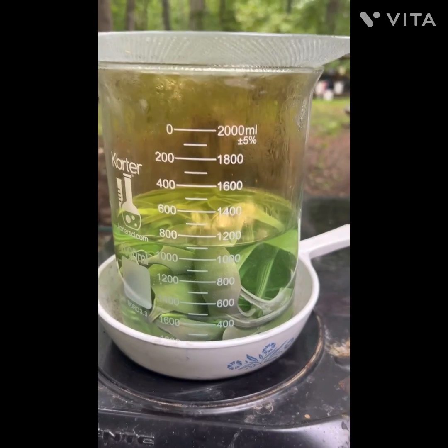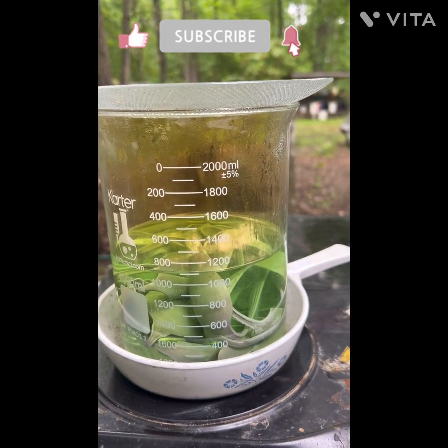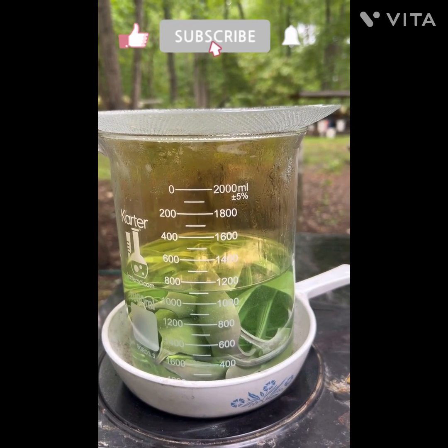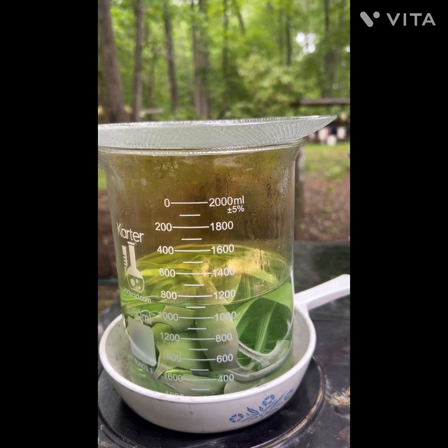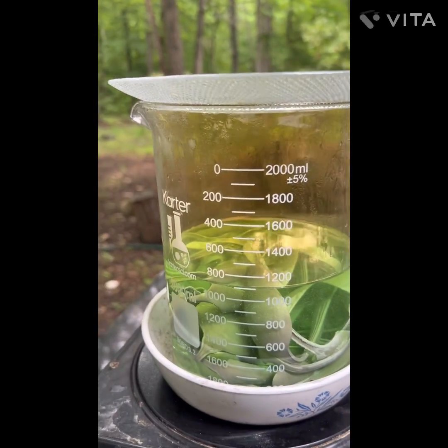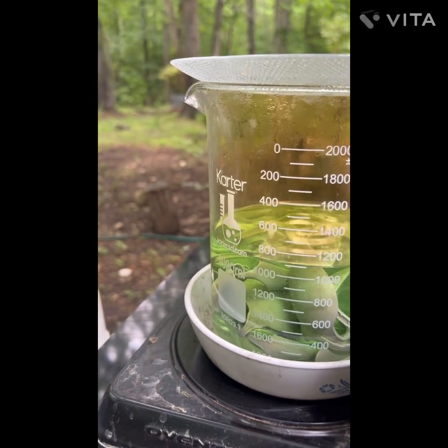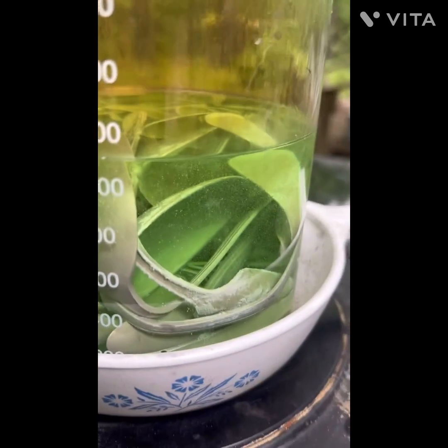Welcome back. We've let this sit for a while at 72 to 74 degrees today and it really didn't have much reaction, so I added a little bit of nitric to this sulfuric acid solution and a little heat — probably tap that back a little.